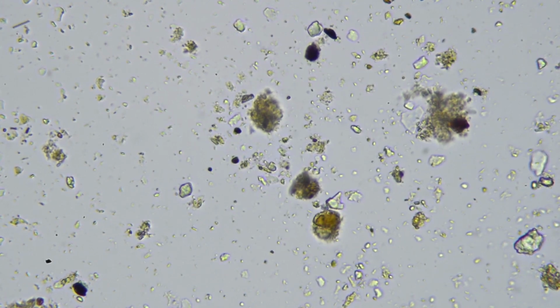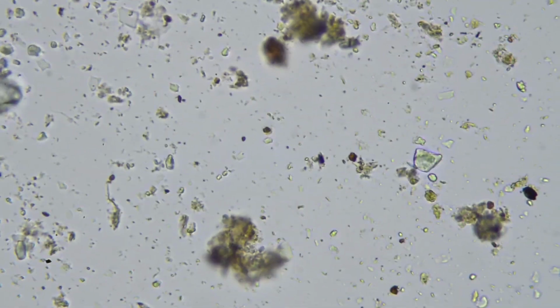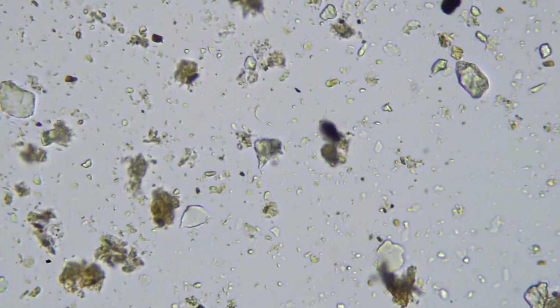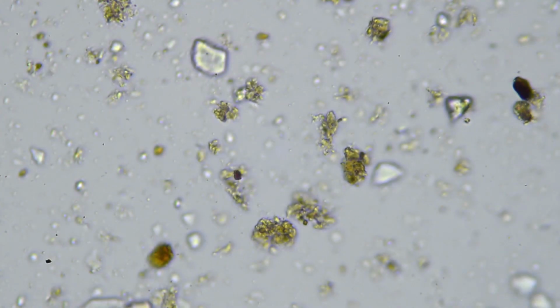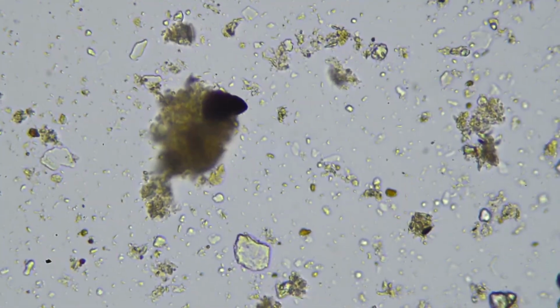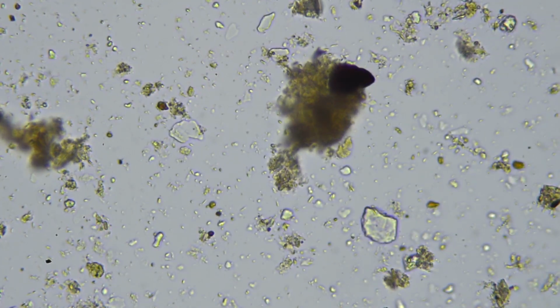This mineral soil looks quite mineralized, so it doesn't look homogeneous, which is what you're looking for when you look under a microscope. You want everything to be pulled together. Soil's kind of fractal, so you want to see a kind of crumb structure almost underneath the microscope, like you would do when you're doing some sort of VESS kind of assessment. So there's a big aggregate there. But you don't want to see too many individual minerals, really.